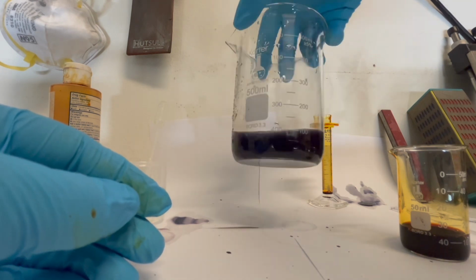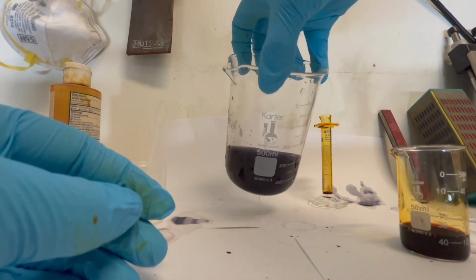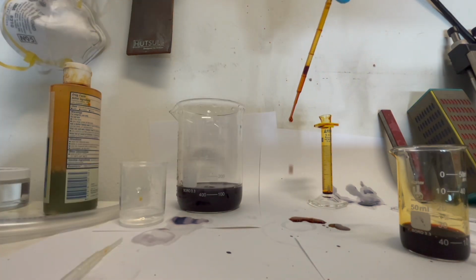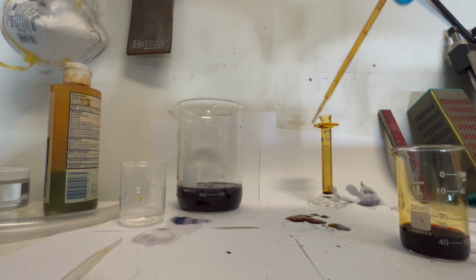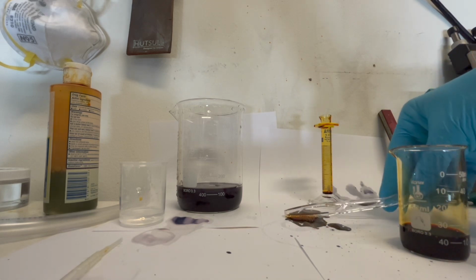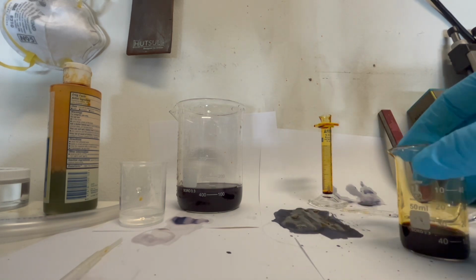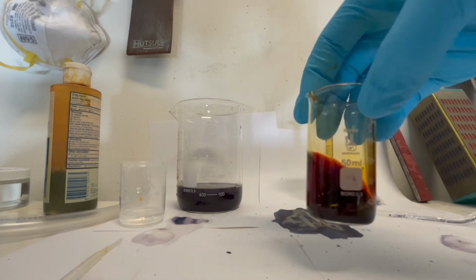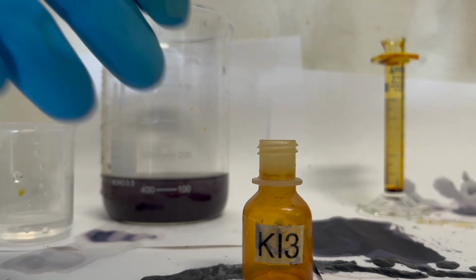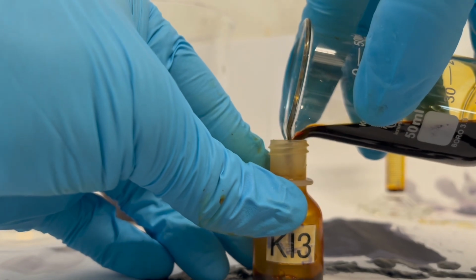It's important to note, though, that this is the standard procedure for making triiodide, and in a laboratory setting, molecular iodine would be combined with a solution of potassium iodide or sodium iodide, and it just makes more logical sense to use the original povidone triiodide complex because it already has the properties of the triiodide ion. However, this channel wouldn't be as exciting without experiments, and I decided just to build the triiodide ion from the ground up to show how it is made in laboratory settings or as a reagent. I transfer the rest of the sodium triiodide into an eyedropper bottle labeled potassium triiodide. However, this is just from an earlier batch and the label will be changed.